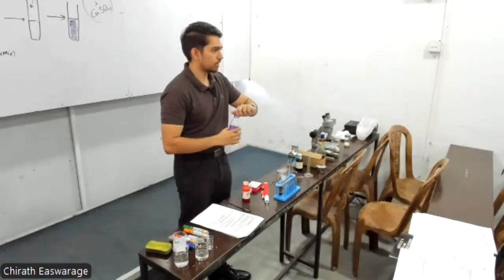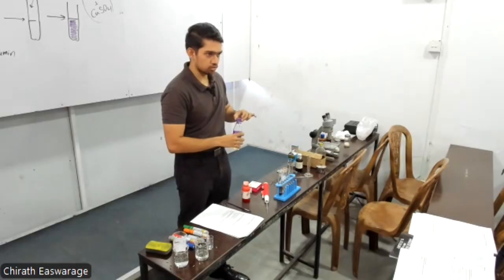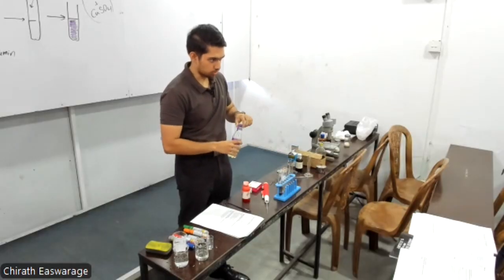It smells exactly like thinner, right? Thinner is what? Acetone, right? Acetone is non-polar.